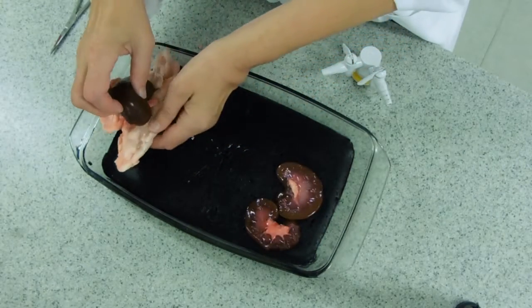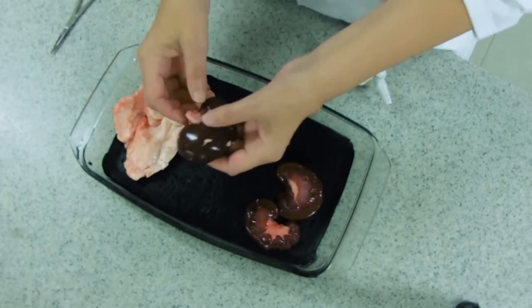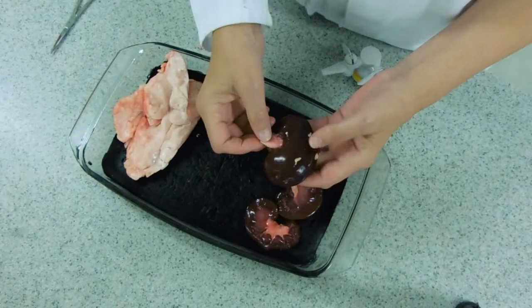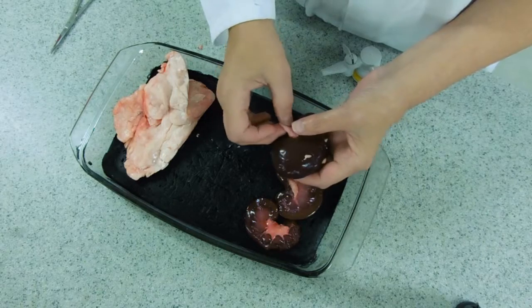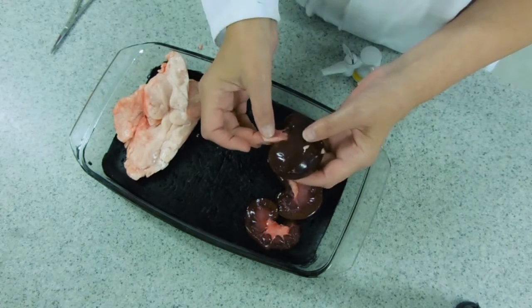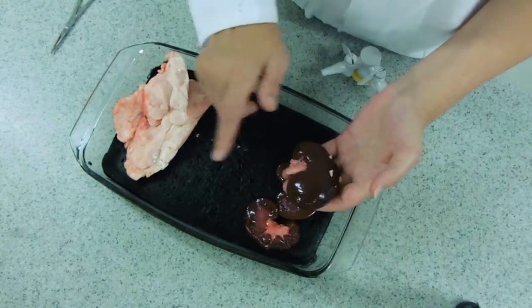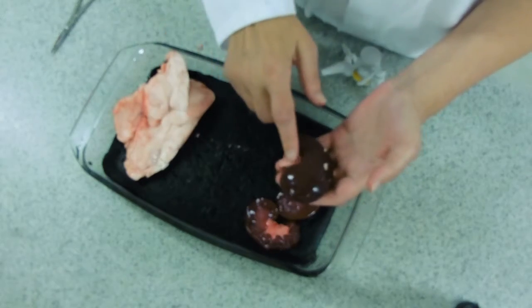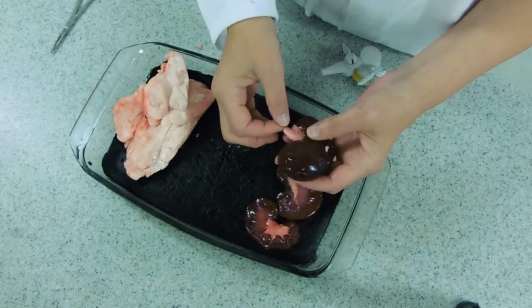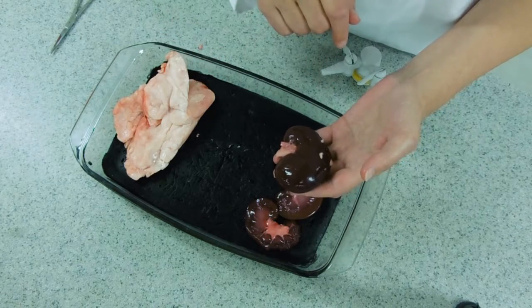So when you've extracted your kidney out of the fat — it should just tear off with your fingers — you'll be able to see that it is still attached through the fat by some tubes. I've just snipped through these. These tubes contain the blood vessels: this bit contains the blood vessel going into the kidney, the renal artery; the blood vessel leaving the kidney with less urea in it, the renal vein; and the ureter which is taking the formed urine down into the bladder for storage.